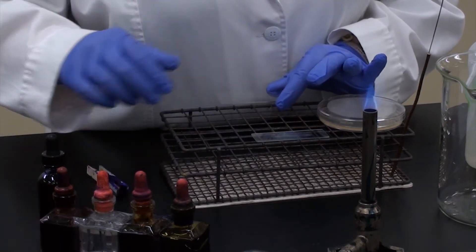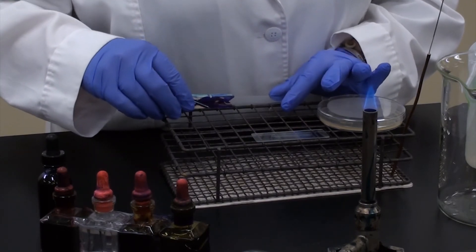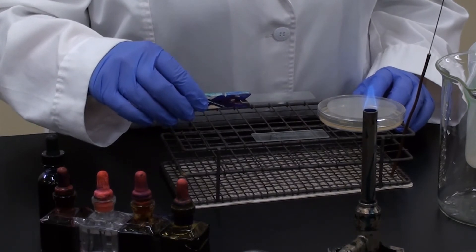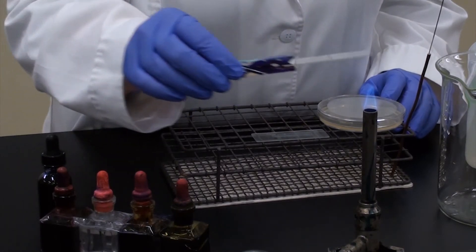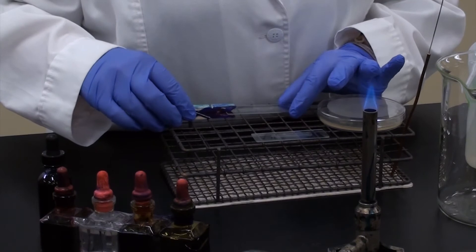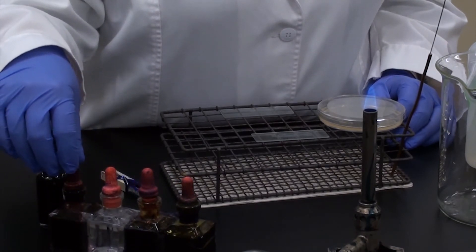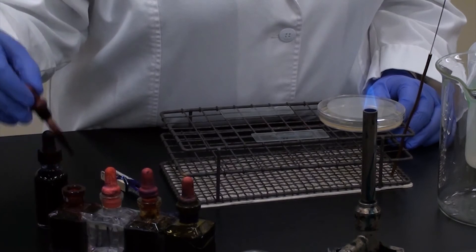I've already pre-dried a slide here, so I'm going to heat fix the bacteria to the slide. Heat fixing has a couple of purposes: one, it's going to kill the bacteria, and two, it's going to adhere it permanently to the slide. To heat fix, you're just going to pass it over your open flame two to three times very quickly. Now, a simple stain consists of a positive stain attaching itself to the negative bacteria. In this case I'm going to flood the slide with safranin, but you can also use crystal violet or methylene blue — they will all do the same thing.